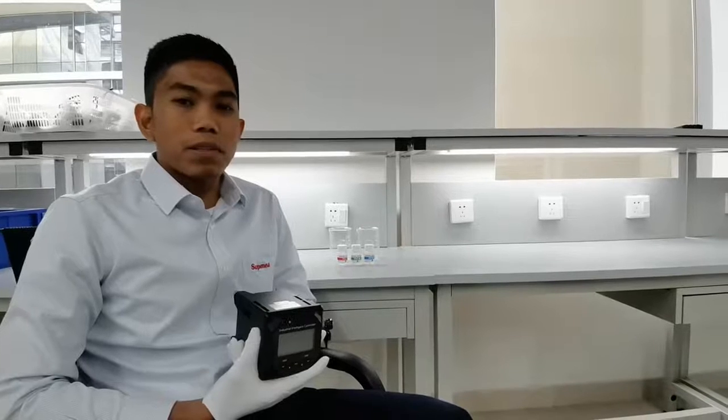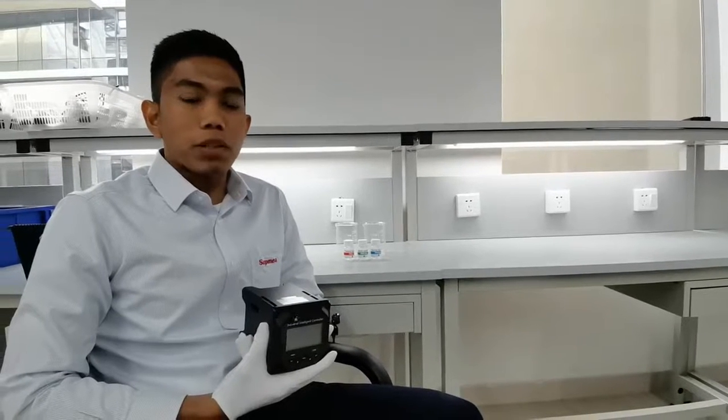Hi! Good day! I'm Jason from the Philippines, working at Supmea Automation. Today, I will show you how to calibrate our pH meter.